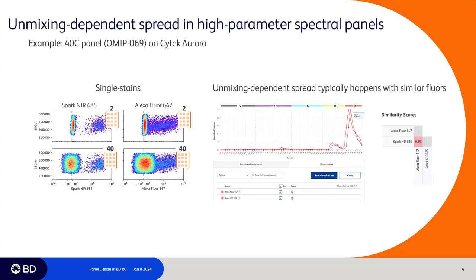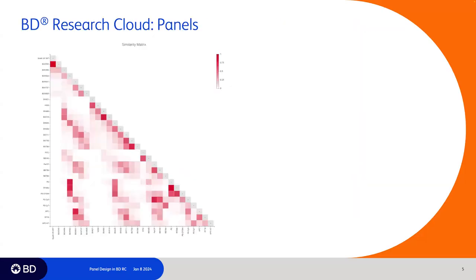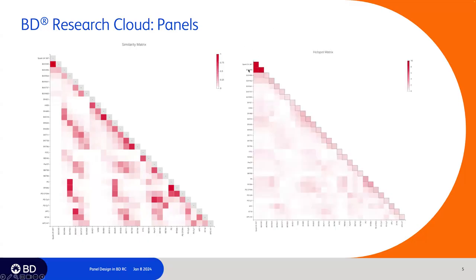Unmixing dependent spread typically happens with similar fluors. So if we look at these, they do have a similarity score of 0.89. So you might think that using the similarity matrix alone can help you prevent this error. However, here is a different panel, and we're looking at the similarity matrix here. You can see that there are high values in the darker red based on the scale. And so simply looking at the similarity matrix and having these higher scores in many places, it's difficult to tell which one of these combinations in the context of the current panel will lead to unmixing dependent spread. Using the new tool that we're providing in BD Research Cloud, the hotspot matrix, this quickly tells you which exact combination of fluorochromes is leading to this unmixing dependent spread. So it takes the guesswork out of it.